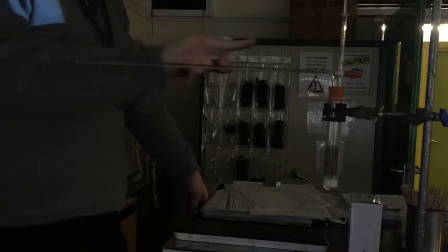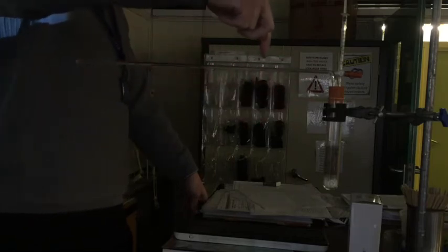Now the important thing is, is now that bubble's there, that seals this entire section. So if any gas gets used in this tube, that bubble is going to move in that direction. If gas got produced, it would move in this direction.